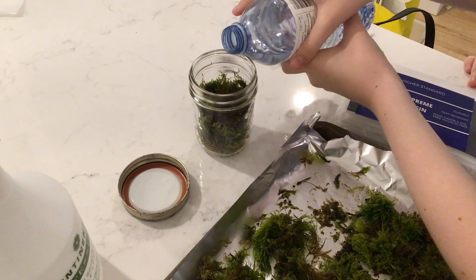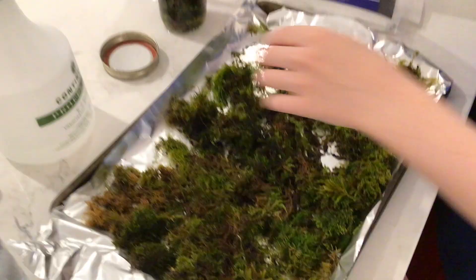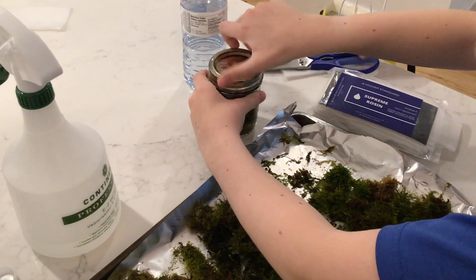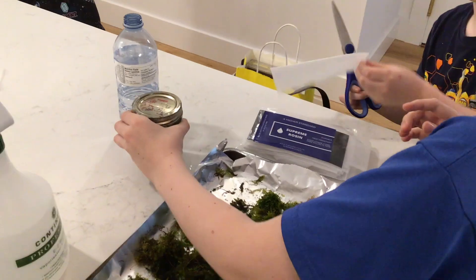Very pure. We've just had this water for a couple of years. We just make sure that it has no impurities in it, because tardigrades just might not like certain things. So we just try to make sure it's as pure as possible.